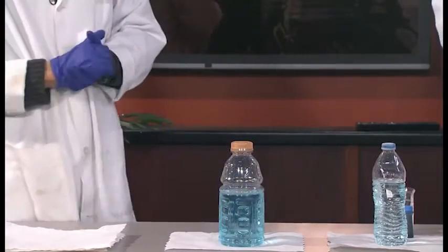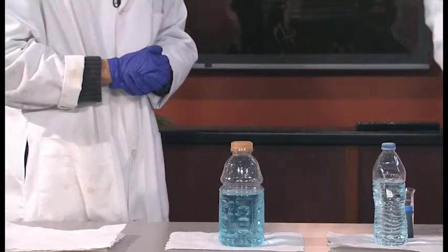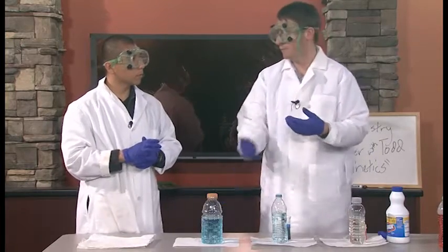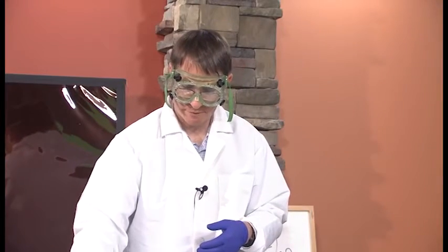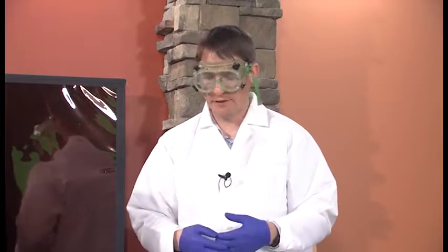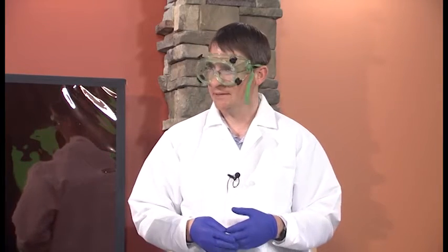Oh, we went straight to blue. It went straight to blue. So initially it was green, and then within just a few seconds it went from green to blue, and then after it goes to blue, it eventually goes to colorless. So in this example, we can explain that because this is a mixture of the yellow and the blue food colorings. We saw earlier that the bleach reacted very quickly with the yellow that's present, and so if you take a green solution and you remove the yellow, then you're left with the blue solution. Okay. So we get the blue solution that will eventually go to colorless the same way that the middle blue solution is also eventually going to colorless as well. Make sense? Yes, it does.